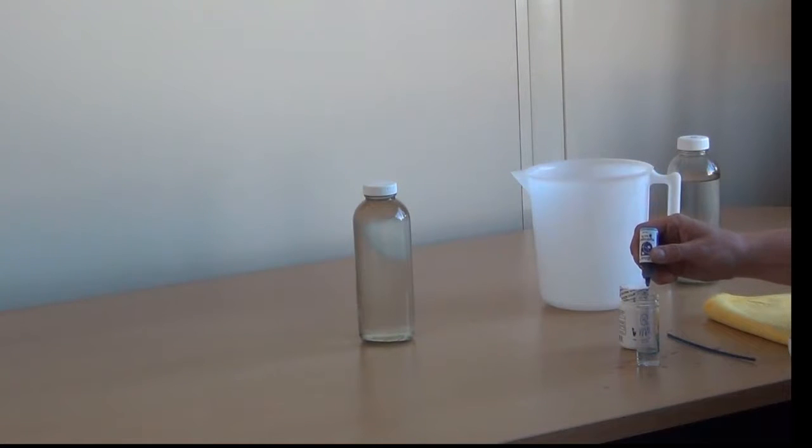Keep adding drops, counting. This is drop number four, five, six, seven, eight, nine, ten, eleven, twelve, thirteen.